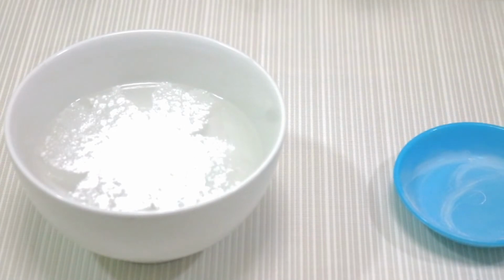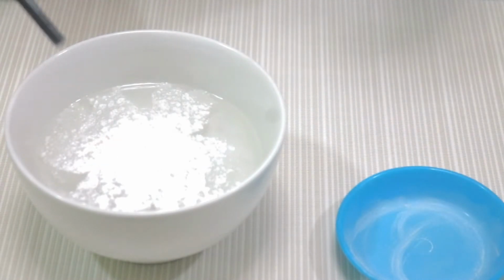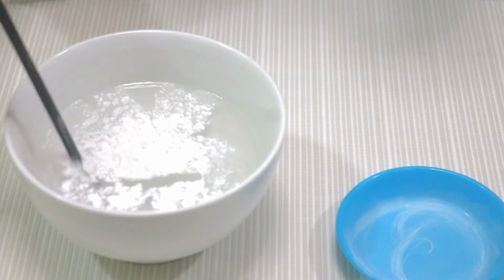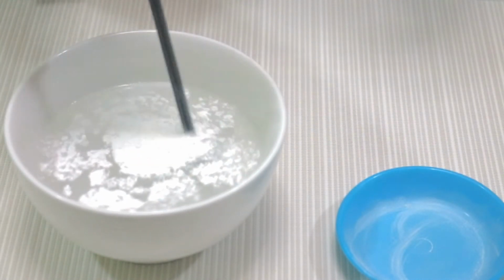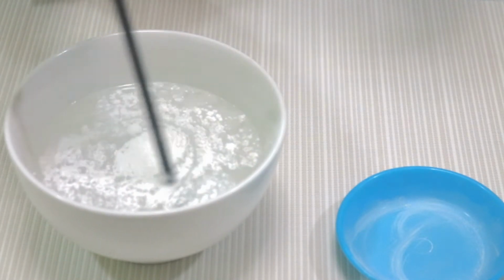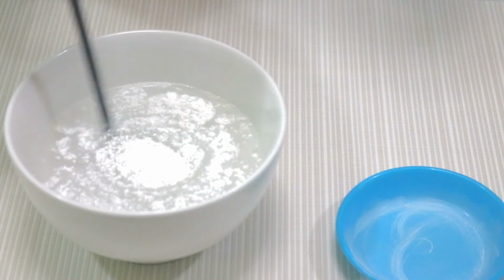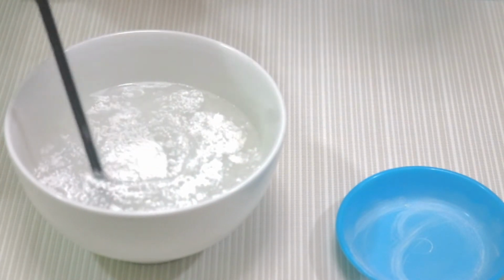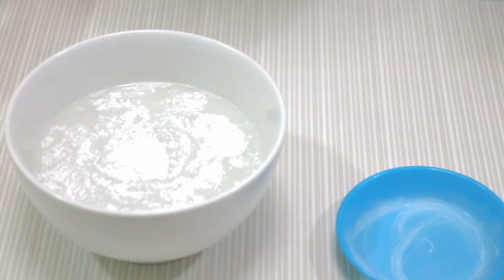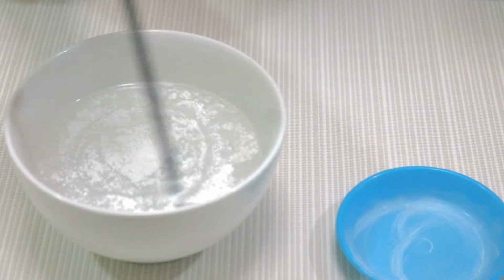And then you can see that the talc powder doesn't drown, even when I stir the powder. They are not drowning in the water because there is no addition of a wetting agent or surfactant, which can reduce the surface tension, so that when water is added to some powder containing several fatty substances, it cannot be completely mixed and the powder granules are not wetted.